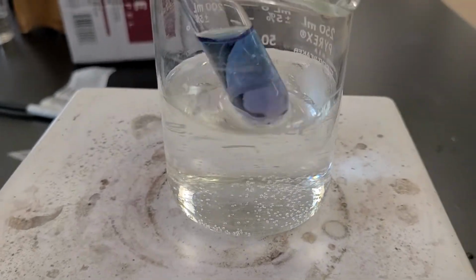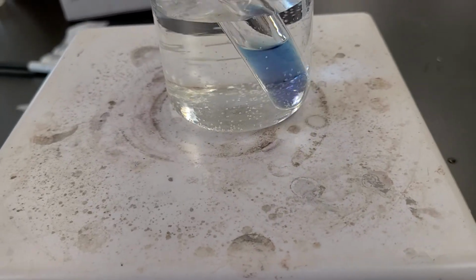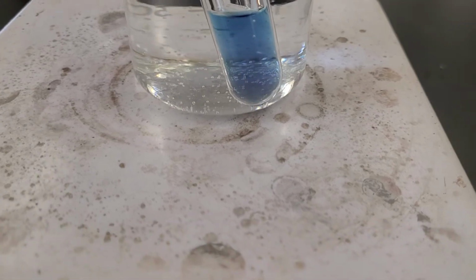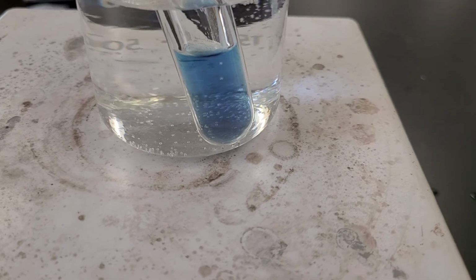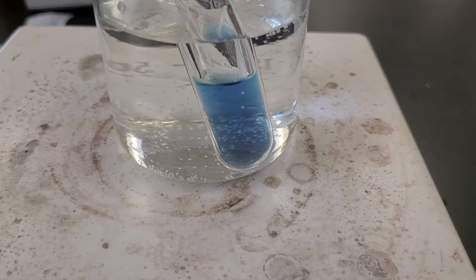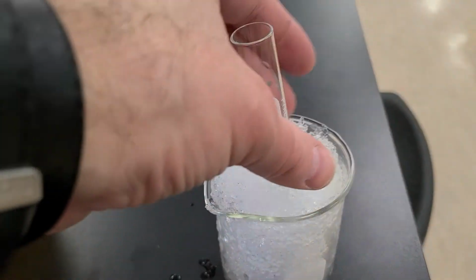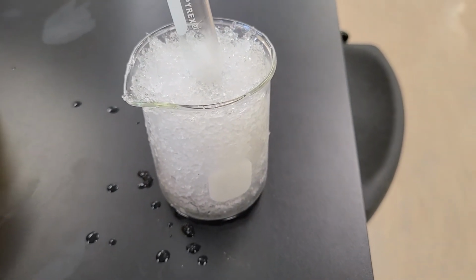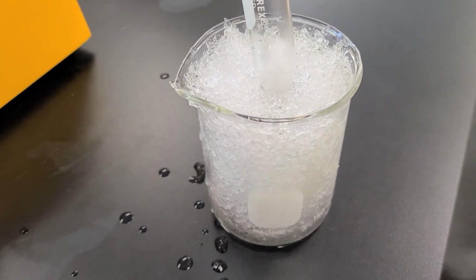Take a look at that color. Ooh, got a bit of sizzle by the drizzle. Look at that. So there we go. Hot water turned that back into this color. And yeah, we could put it back in here. It'll take a little while, but I can just keep going back and forth here. Have a good old time here. Heating up, cooling down. Of course, cooling down means removing heat.